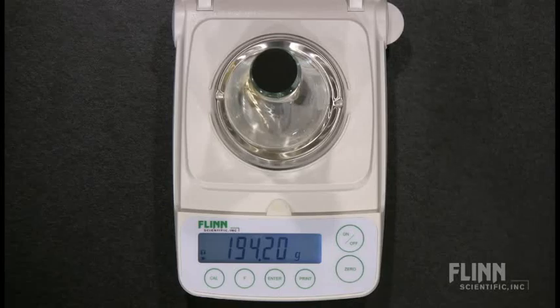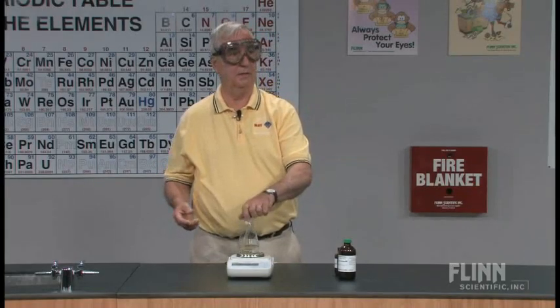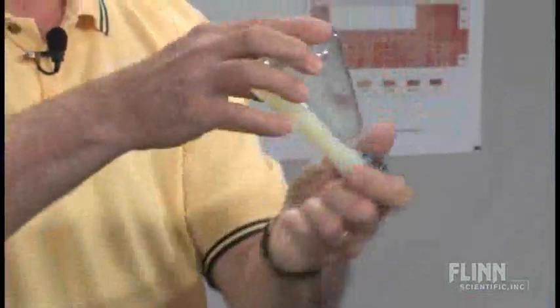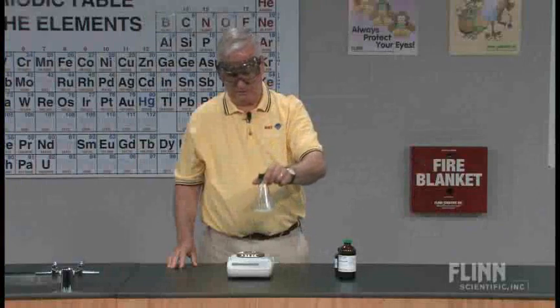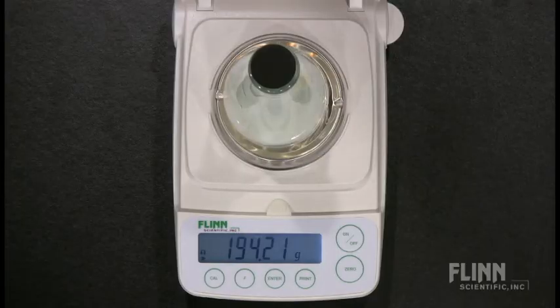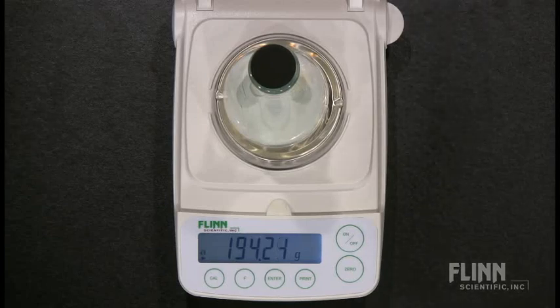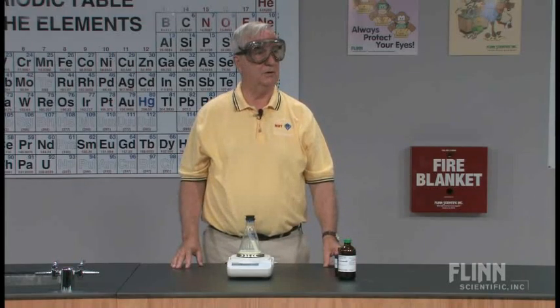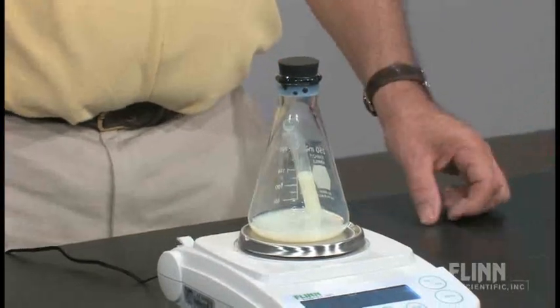Now, to carry out the chemical reaction, we have a very simple process. All we have to do is remove our flask, invert it, allowing the two liquids to mix with one another. What we see is a reaction and a reaction product. The reaction product here, of course, is silver iodide — a yellowish solid. So we're able to see very quickly and very readily the chemical change. We can talk about some of the evidence of chemical change: we have formed a solid because it is opaque, and we have a color change — we have gone to a milky yellow color.